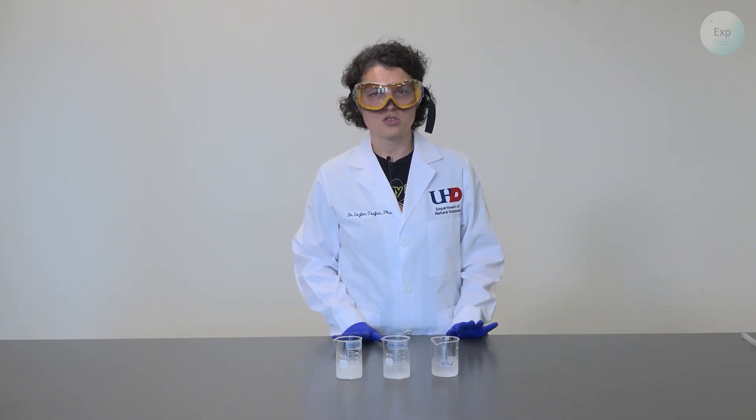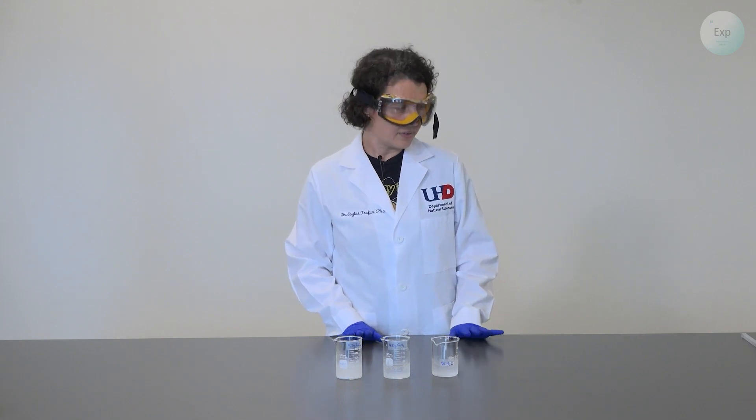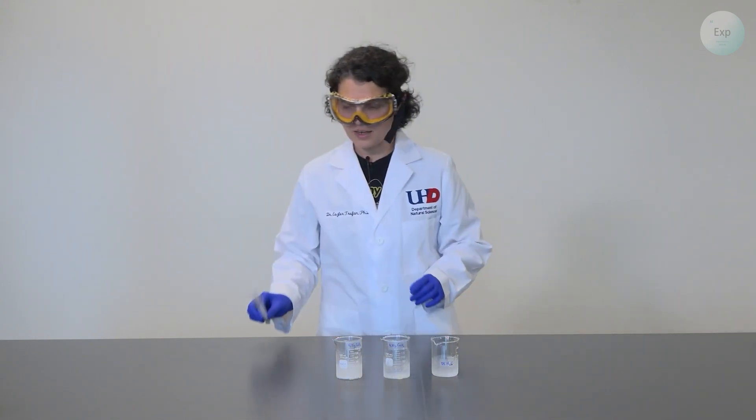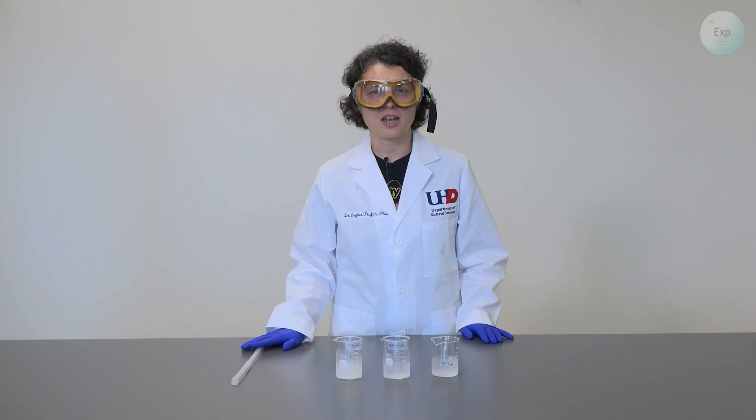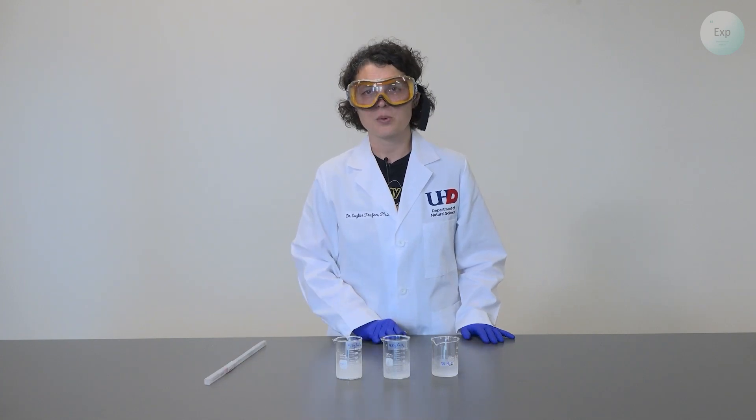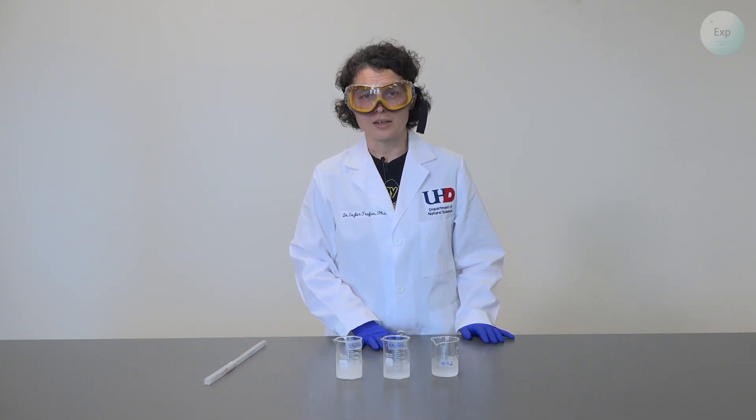For this experiment we're going to need just a little bit of instrumentation. The first thing is a thermometer because we will need to monitor any temperature changes that may occur and then the second piece of equipment that we need is a hot plate.